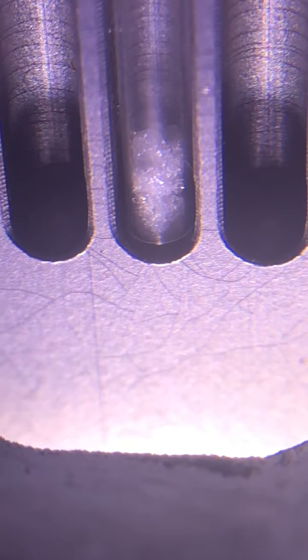You might be noticing the sample getting a little bit smaller but you don't see any liquid form. It's getting smaller, sometimes this happens a lot at these higher temperatures because the sample begins to sublime. And just notice there's a little bead of liquid. So this is 120.5.